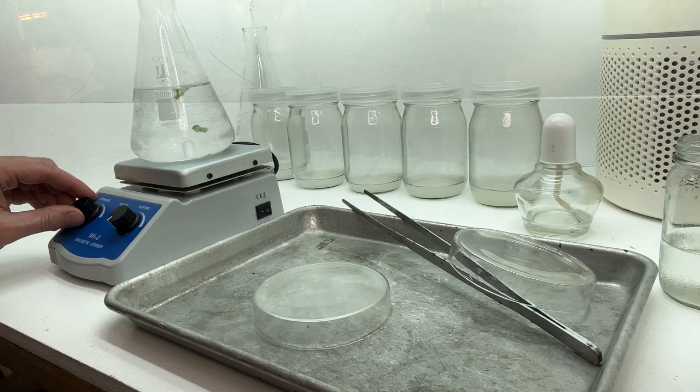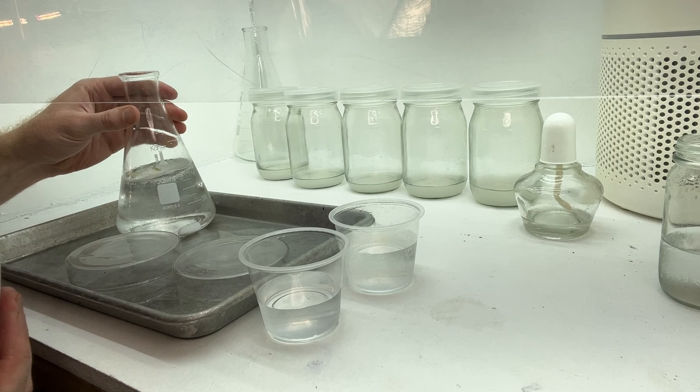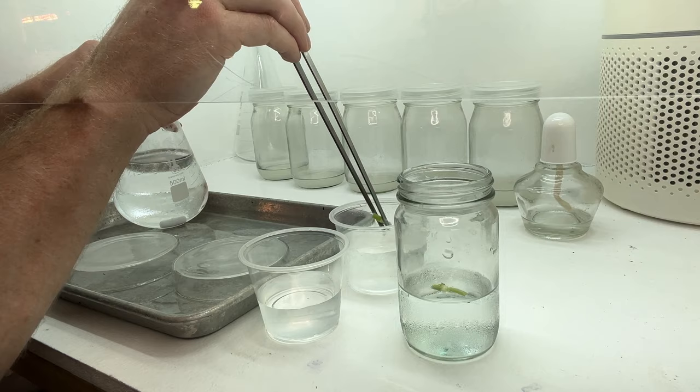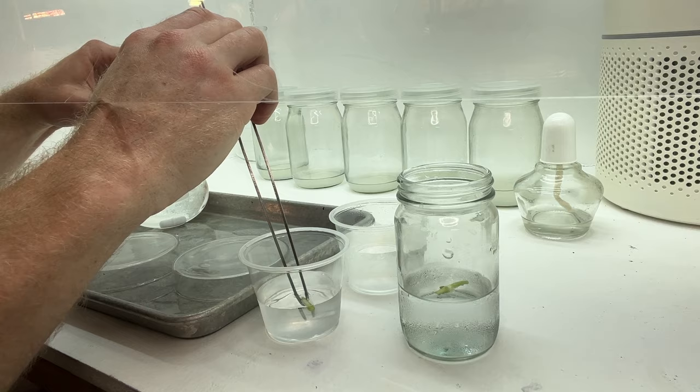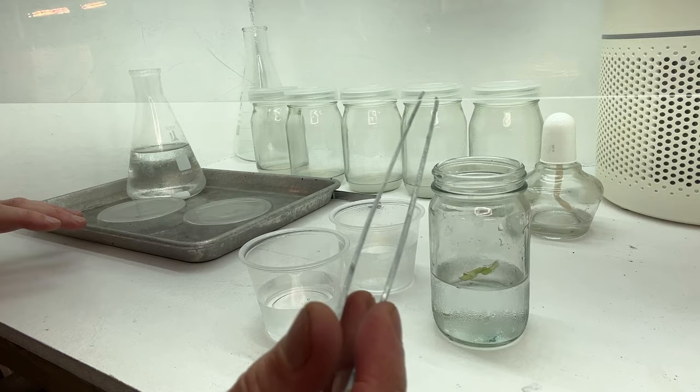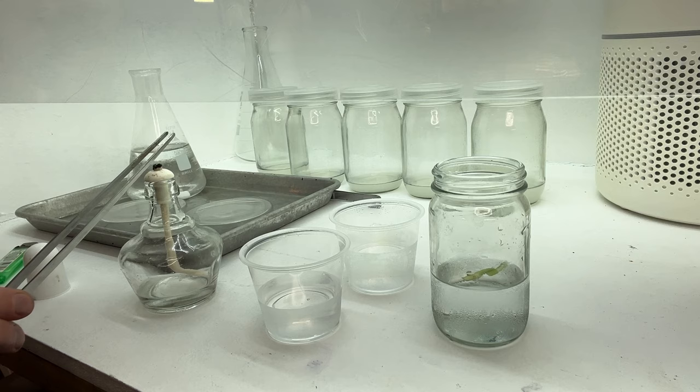We'll now shut down our stirrer and remove our explants from the bleach solution. After the bleach water, we'll do a rinse of just plain water, then over into alcohol — this is 70% ethanol — for about five seconds, and now out into some sterile distilled water. This is the part where contamination can occur because bacteria or fungi can flow into this jar, so we want to be quick. In between this process, it's good to sterilize all of your tools — that's what this torch is for.